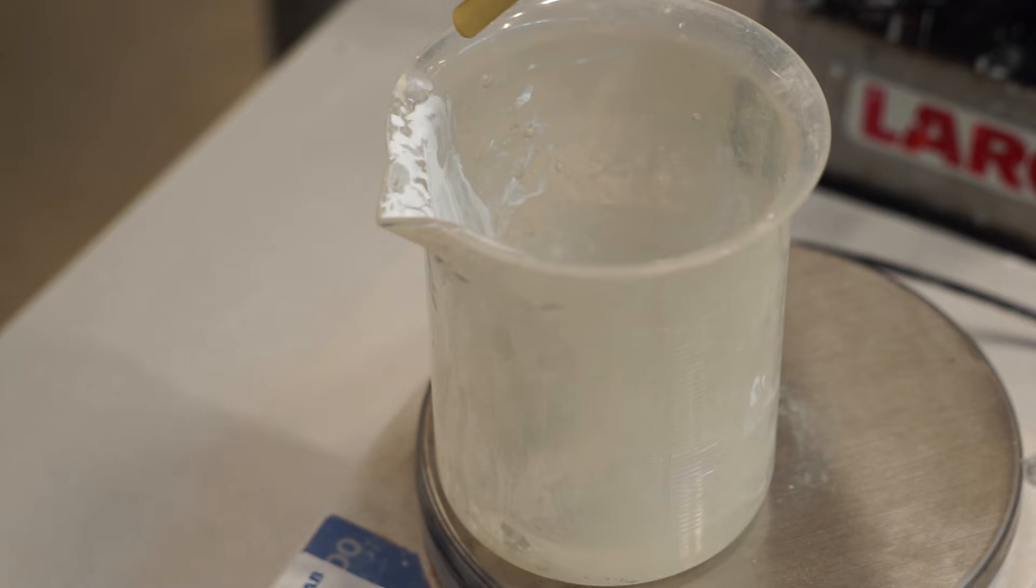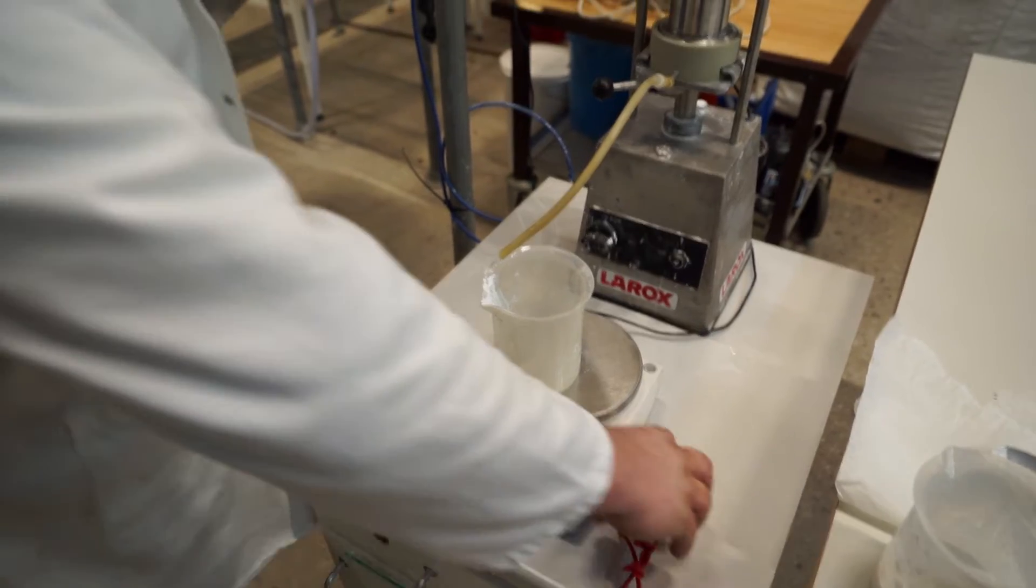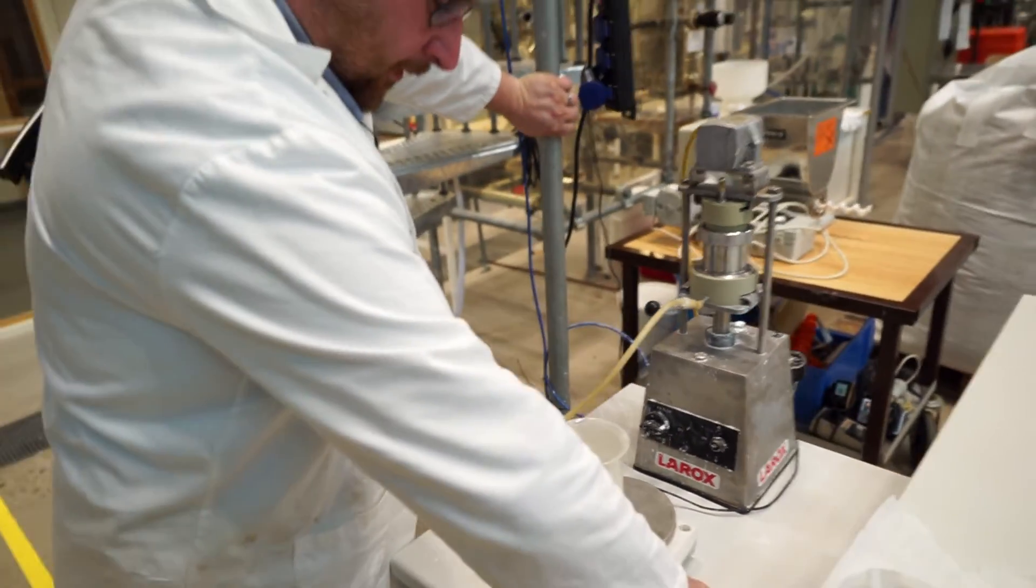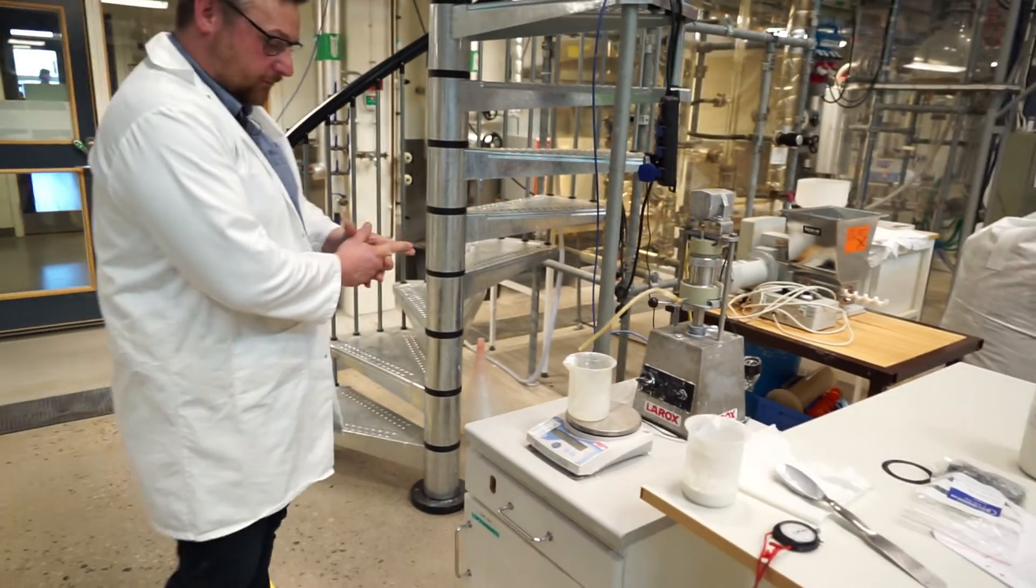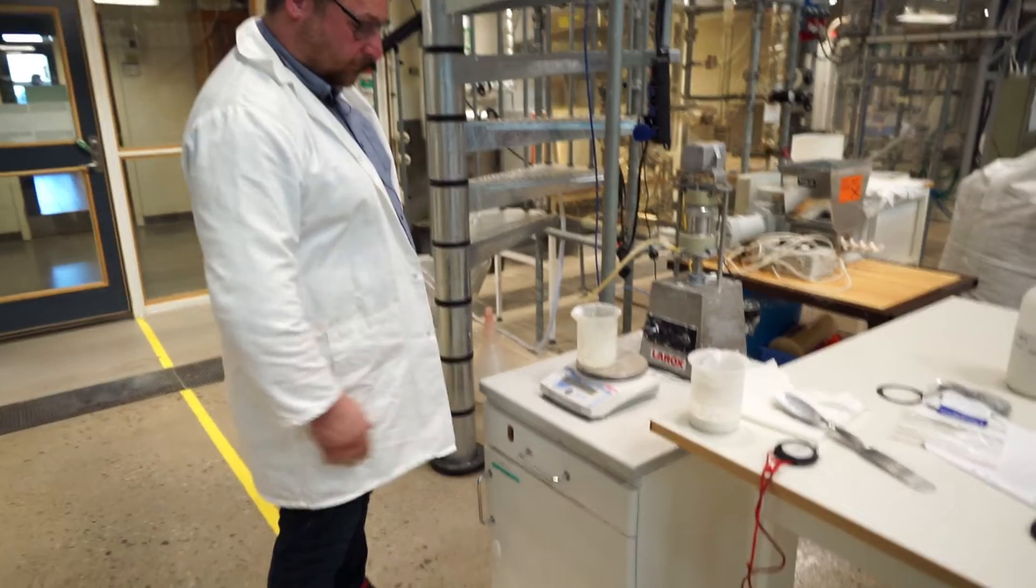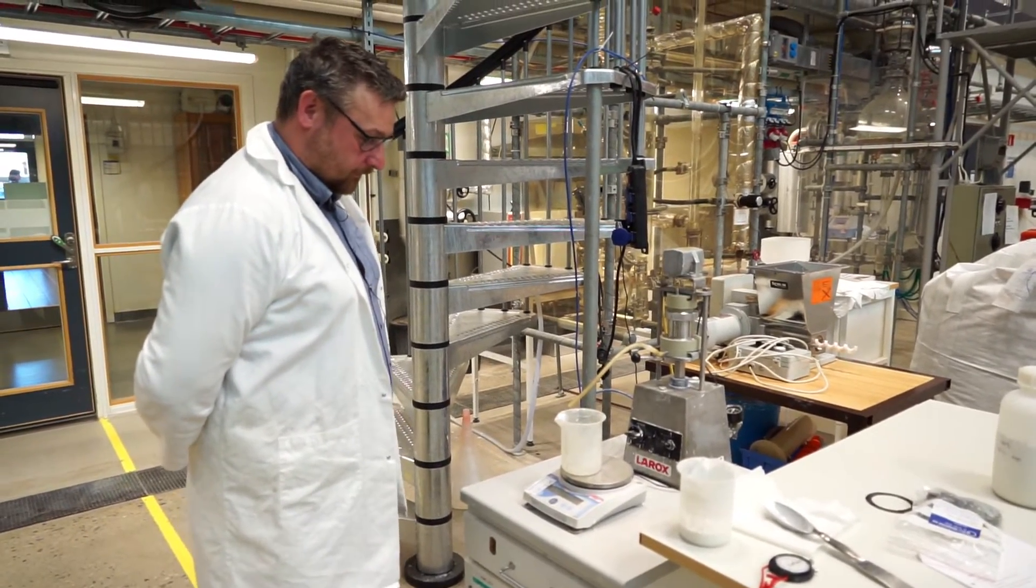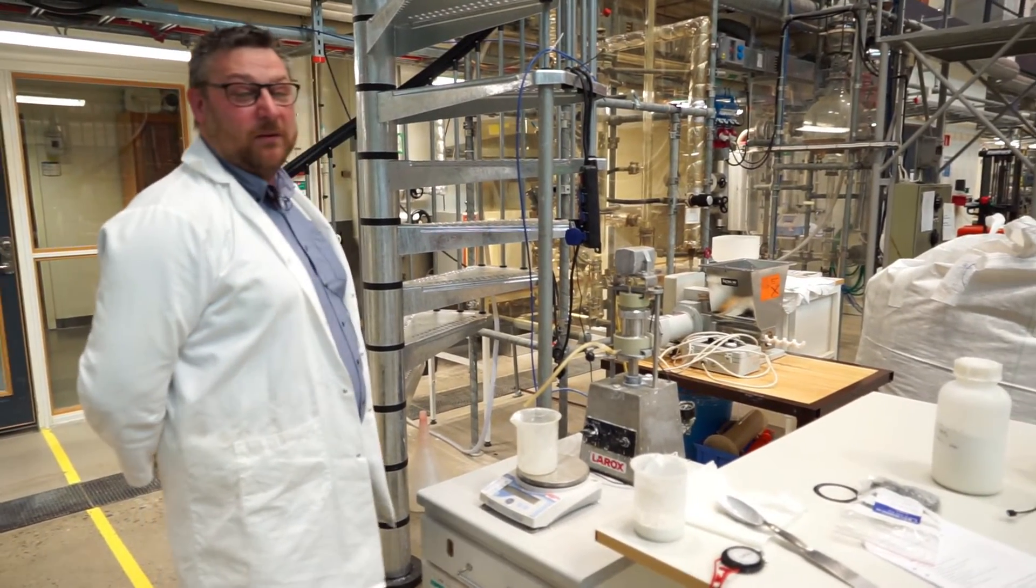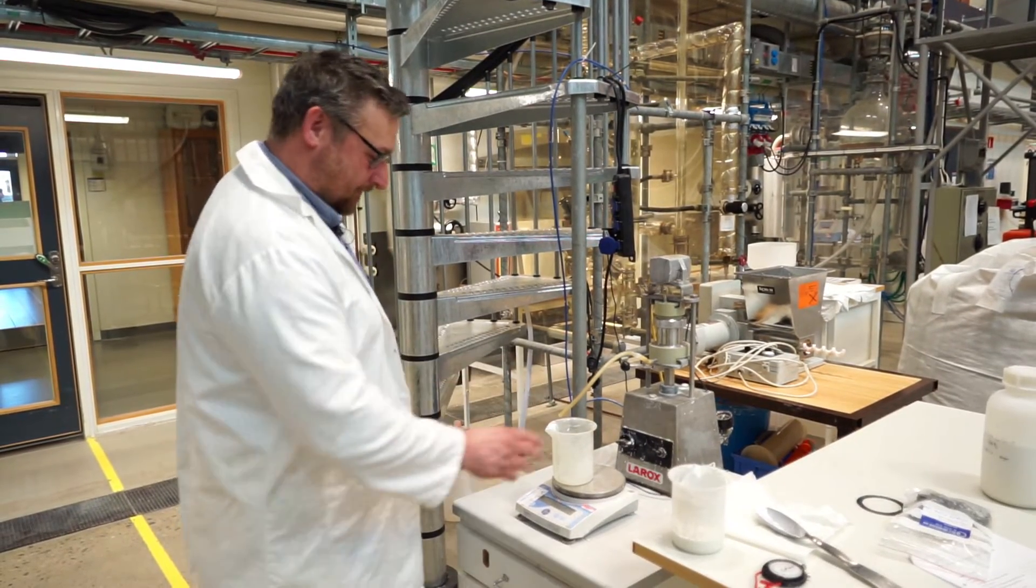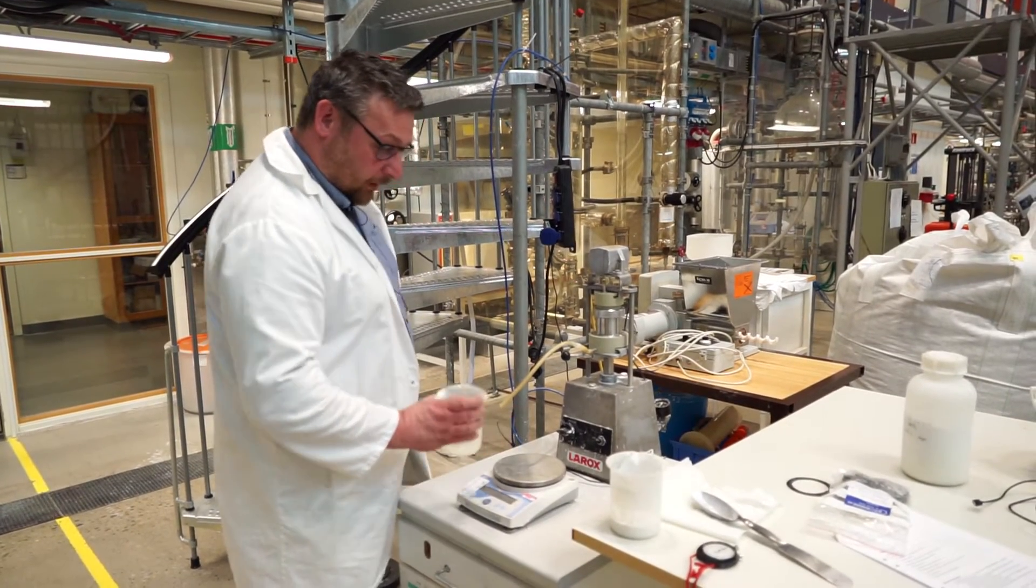Okay, so that was the last droplets. So what do we do now? Yes, now we have all the data that we need. We can stop the timer because we don't need that anymore. So what we should say here is you should note down a few points in time, how much is on the scale and what time it is. Otherwise you don't get any data, right? That's correct. Right now we use the video to do all the noting for us, so to speak. So now we have our filtrate.